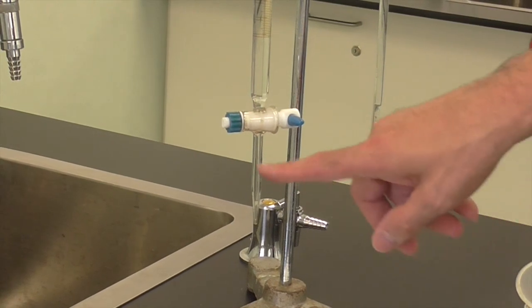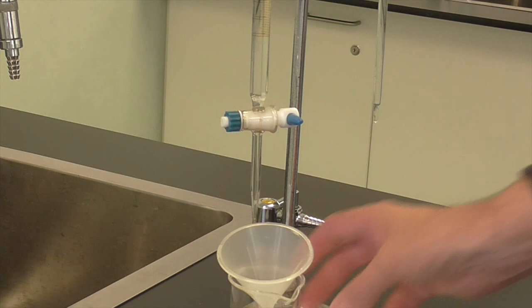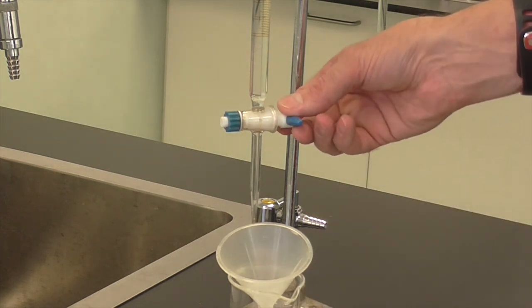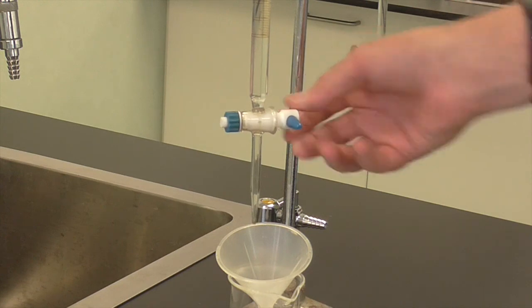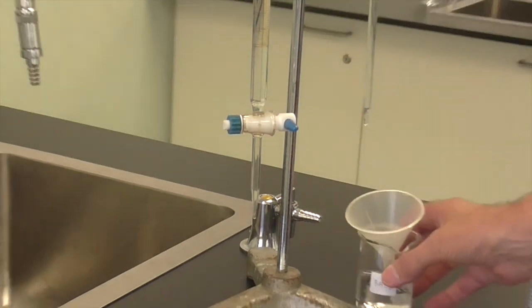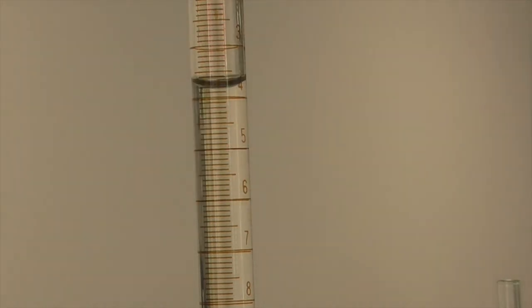Before using your burette, check for an air bubble in the bottom. Get rid of the air bubble. Place the beaker of, in this case base underneath, and gently open a stopcock and close it. That will get rid of the air bubble down the bottom so that we have the right volume in the burette. Read off your initial value, in this case 3.8 mils.